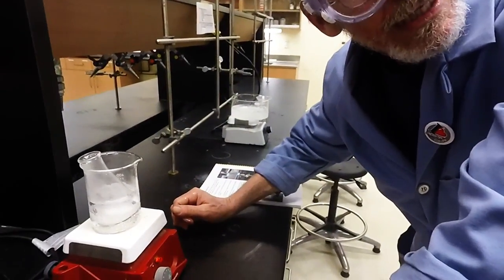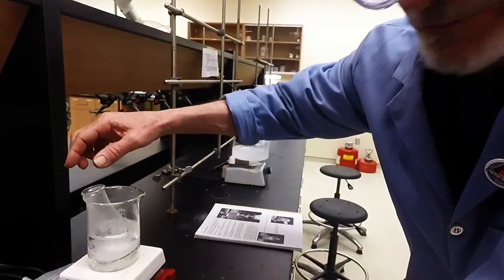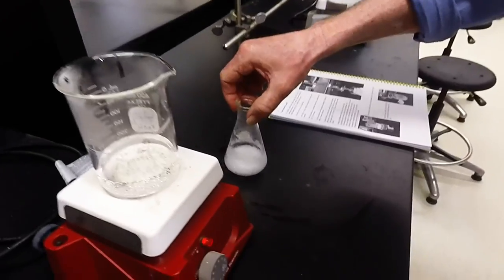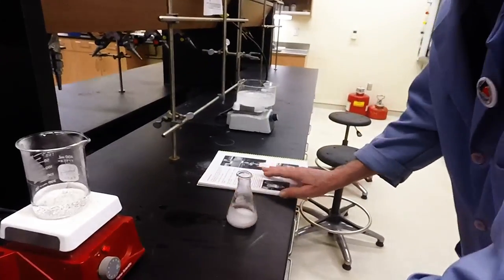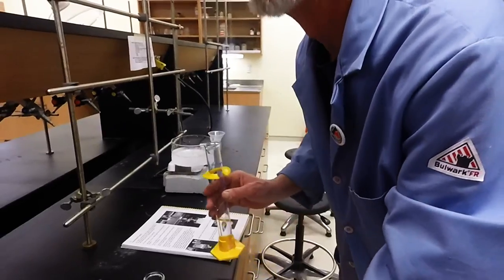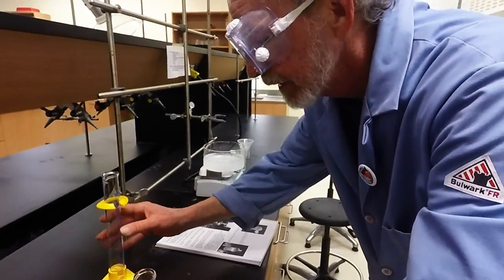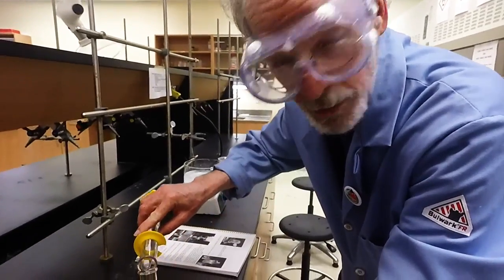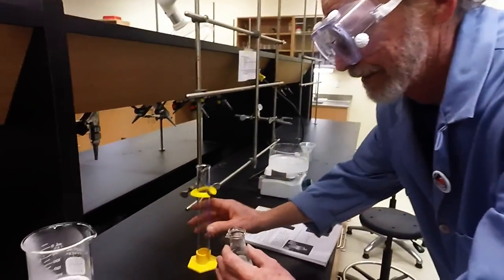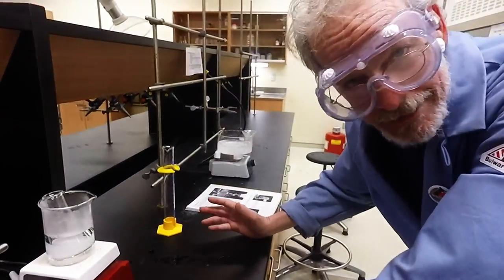So, here we are. We've been boiling away like mad. Not paying any attention at all. And guess what? The methanol's been evaporating. And the solid hasn't been dissolving. We have to add more methanol to get it to dissolve. So, just stand by. I'll go get some more. This is the tricky part about recrystallizing. You're never really sure how much solvent you're going to need. But if it's boiling and it ain't dissolved, you're either trying to dissolve a salt or you have to add more methanol. There. Hopefully that'll do it this time. We'll keep a closer eye on it this time so the methanol doesn't evaporate away.